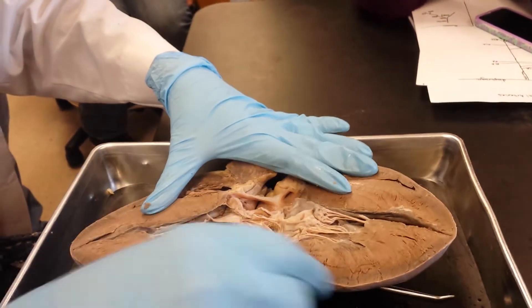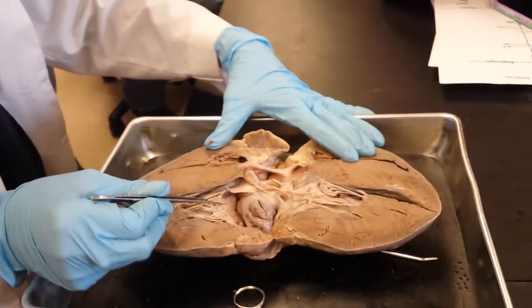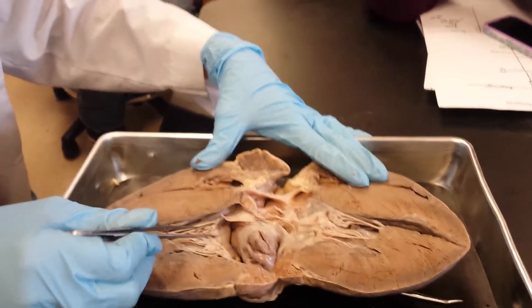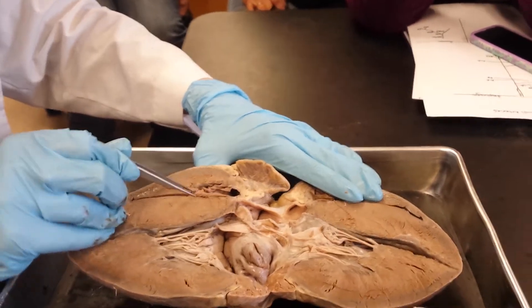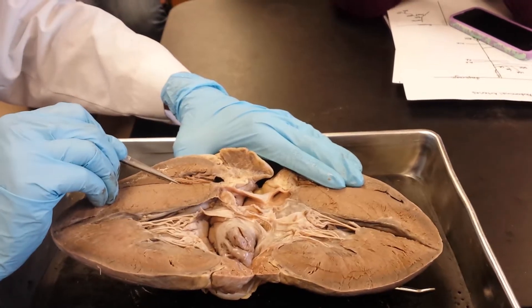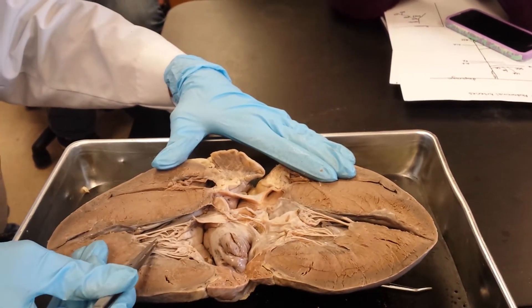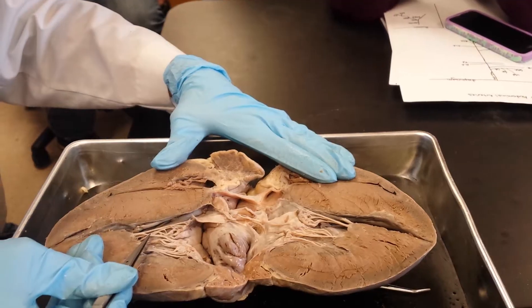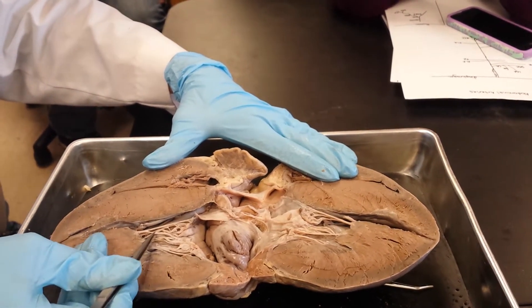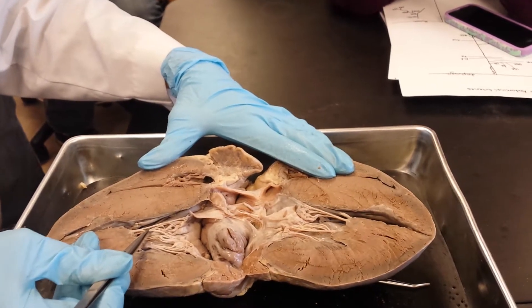This is my left side — so what's the name of this valve? Bicuspid. Exactly. This is my right side — so what's the name of this big valve? Tricuspid. Exactly. Tri before you buy. What are the names of these little strings? Chordae tendineae — you can pronounce it 'chordae tendineae' if that will help you spell it.